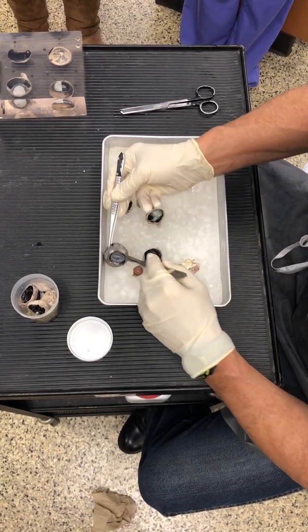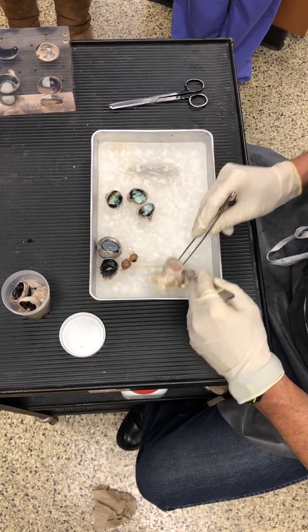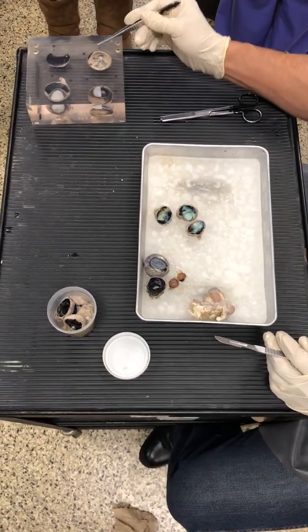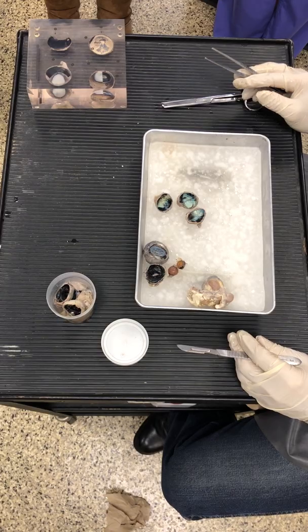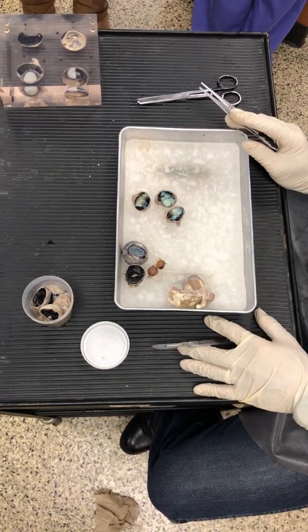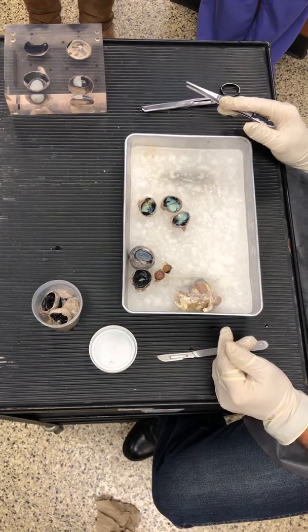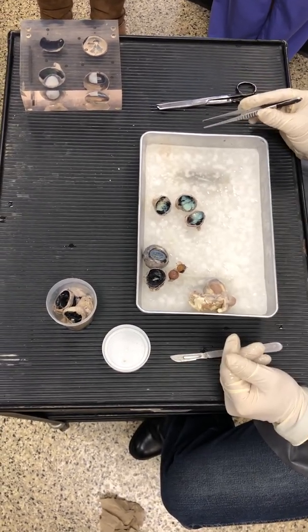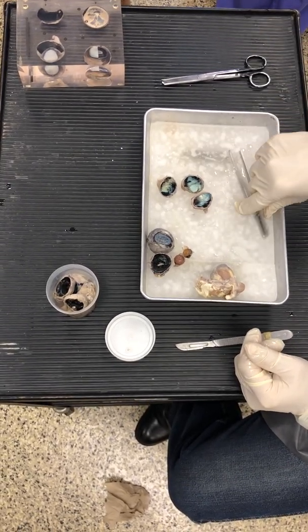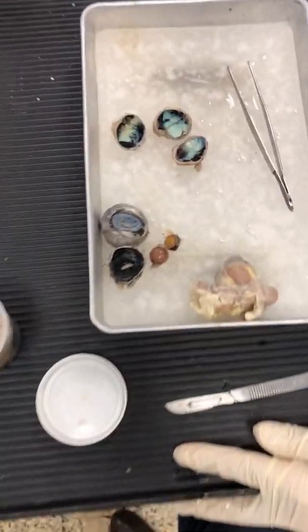We tilt it around like that so you can see it. And then we can see the muscles, etc. So again, photos of these. That one is nice because it has labels, except there's no tapetum lucidum. The tapetum lucidum in your lab manual is not as clear as this. So that's a hard diagram. I've actually gotten a different picture for your course and your lab exam. The lab exam will be these real things, so you can actually see it nicer. Continue on, folks. You can look at this at your own leisure as you go through the lab.